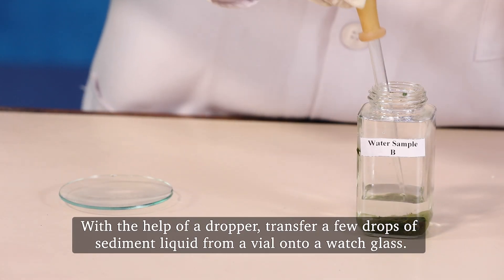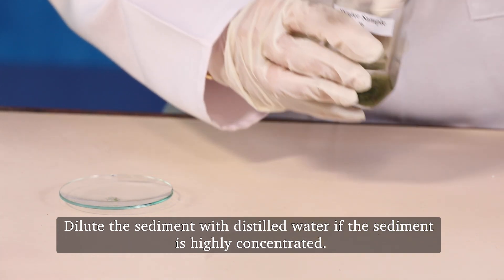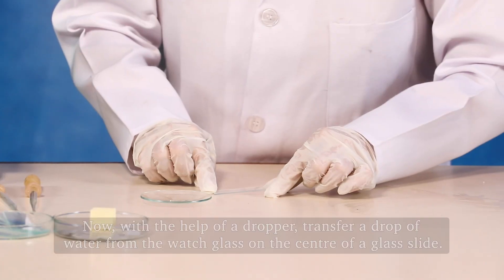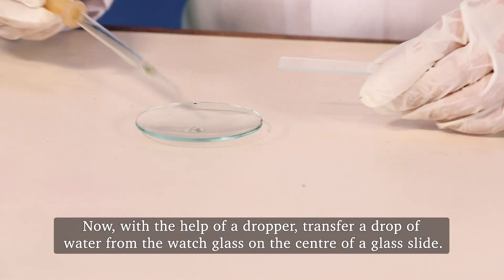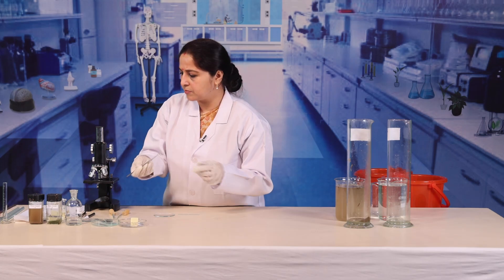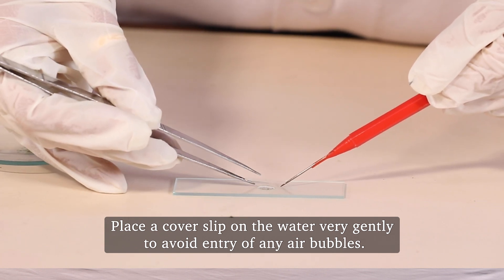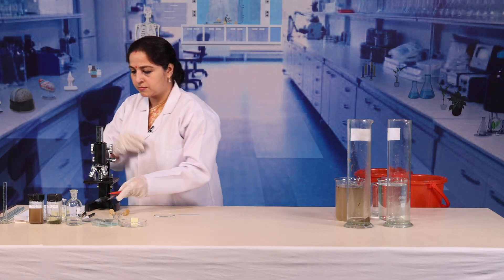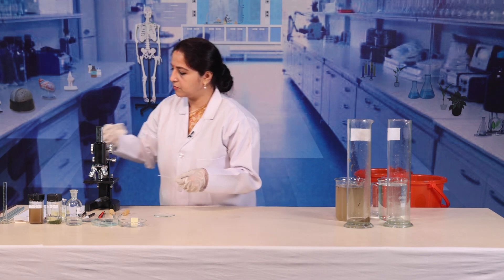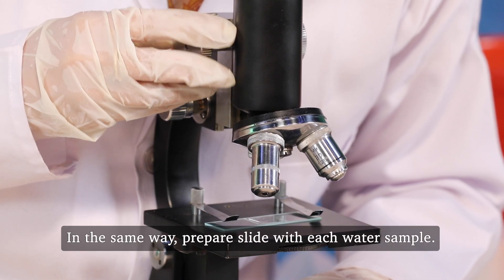With the help of a dropper, transfer a few drops of sediment liquid from the vial onto a watch glass. Dilute the sediment with distilled water if it is highly concentrated. Then, with the help of a dropper, transfer a drop of water from the watch glass to the center of a glass slide. Place a cover slip on the water very gently to avoid the entry of any air bubbles. Blot the excess water using blotting paper. In the same way, prepare slides with each water sample.